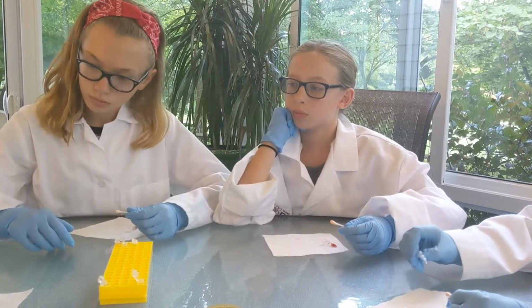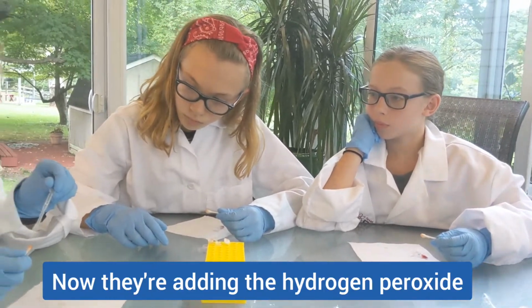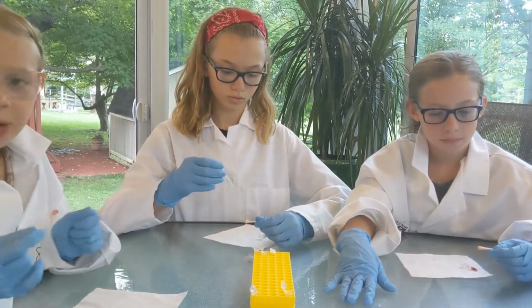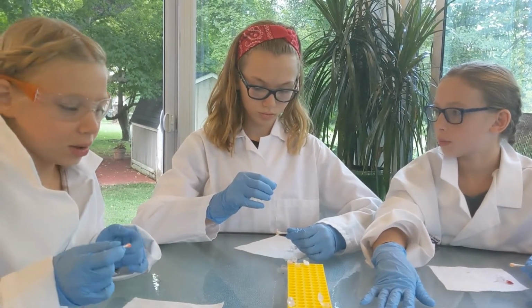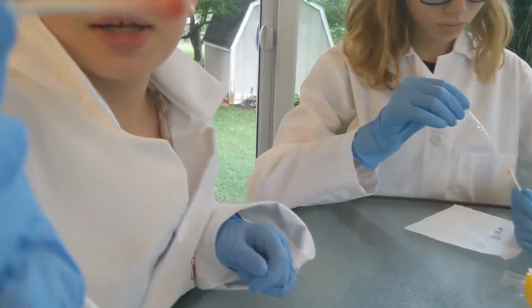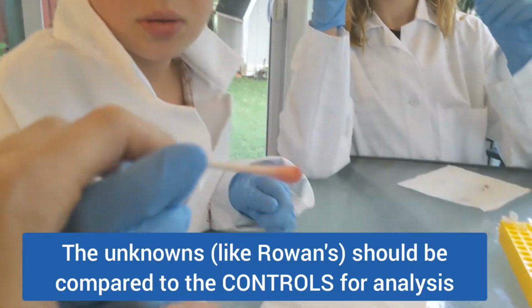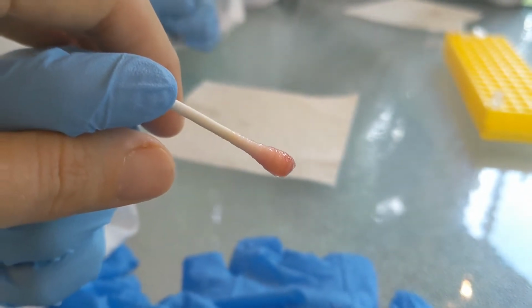So this is the big reveal. Again, careful not to touch it to the actual tip. Good job. What are we looking for? A change of color, pink or purple. And it still looks red to me. Which sample did you have, Rowan? I had number 2. Mine still looks really red. It's pink on this side, but that's because I didn't get as much blood. Do we see any pinkish purple?